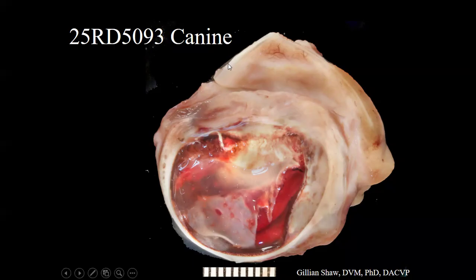So this is the third eyelid here. This is the cornea, which is very opaque. And actually, I think this is the second half of the globe, because we don't have the optic nerve here. So I think a photo was not initially taken of the case. Anyway, we might have a less than perfect representation of the globe in this hemisection. For example, I don't really see the lens here. It might be here, I'm not sure. But the cornea that we do have is opaque.